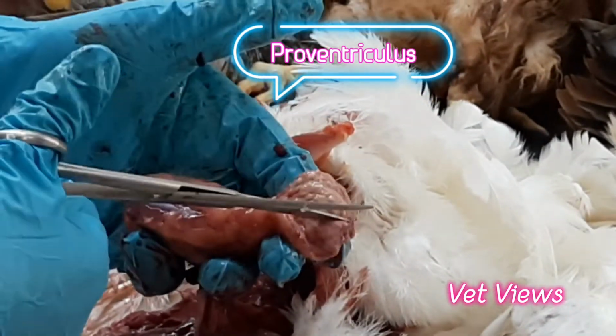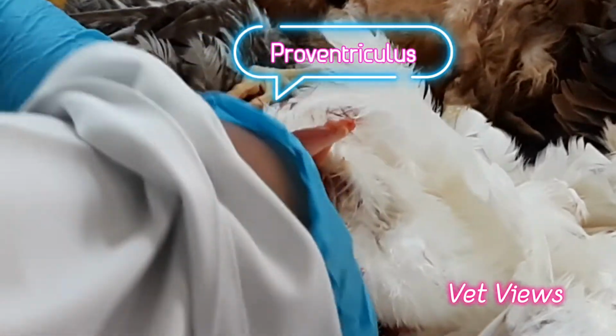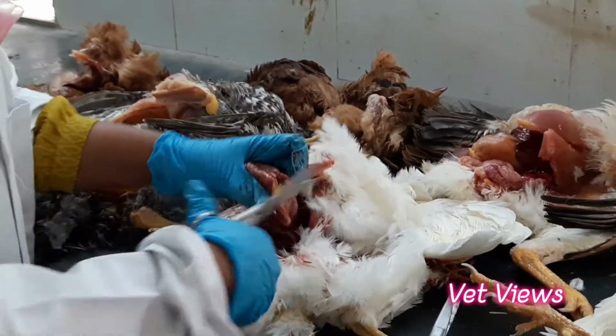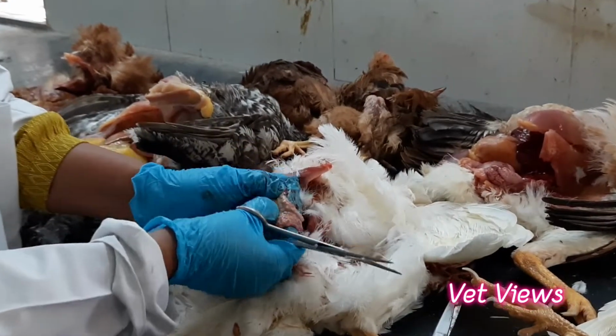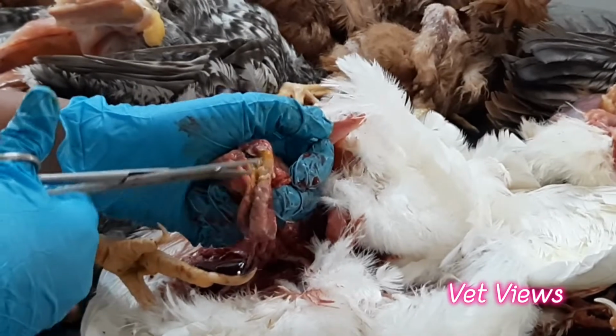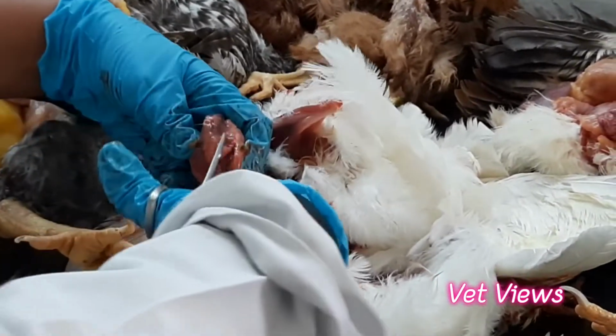And this is the junction between the proventriculus and the gizzard. So just cut at the junction also. In some viral diseases like IBD and others, you will be seeing hemorrhages at this junction. In this mucosal part, there will be hemorrhages you can find. Then examine the gizzard.